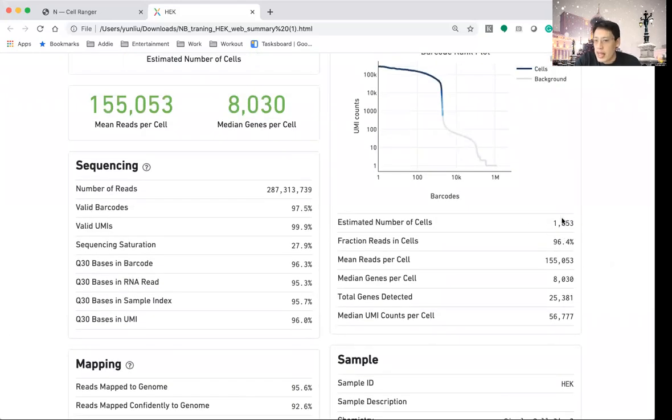Estimated number of cells, 1,800, and the fraction of reads in cells, 96%. So we identified over 1,800 cells, and you see that 96% of the reads actually are detected in the cells we identified.